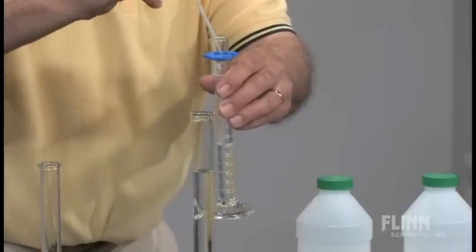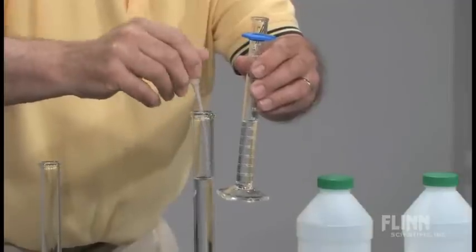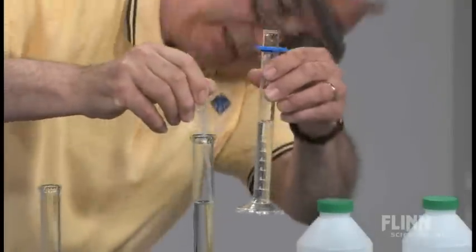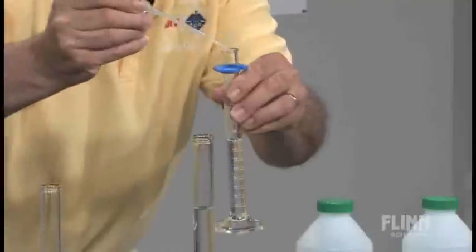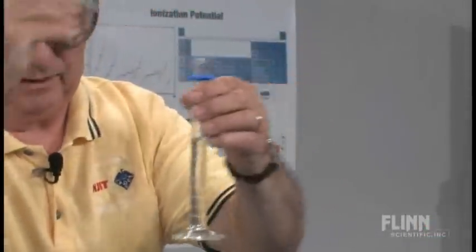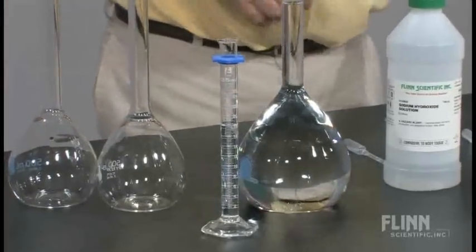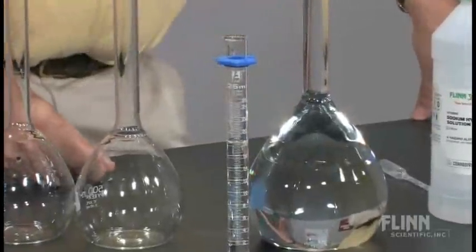If in fact we created a mole of water, simplistically we can say that we should get 18 milliliters of water. And when we take a good close look at the graduated cylinder, we produced 18 milliliters of water.